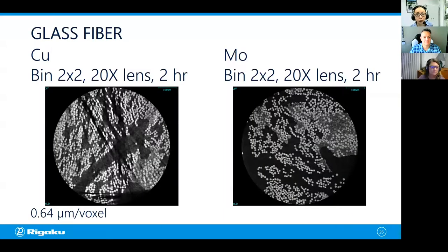Okay, so those are the CT scans from copper and molybdenum for glass fibers you just saw. When you use copper radiation, this was a binning 2x2, 0.64 microns voxel size scan. It took 2 hours.